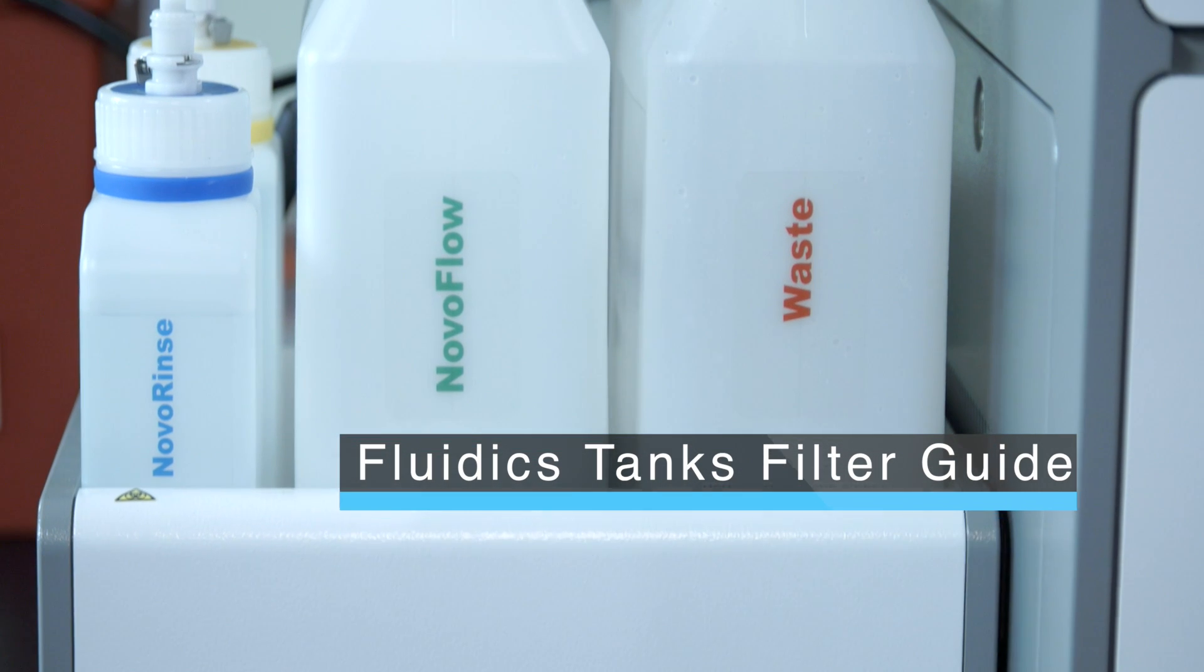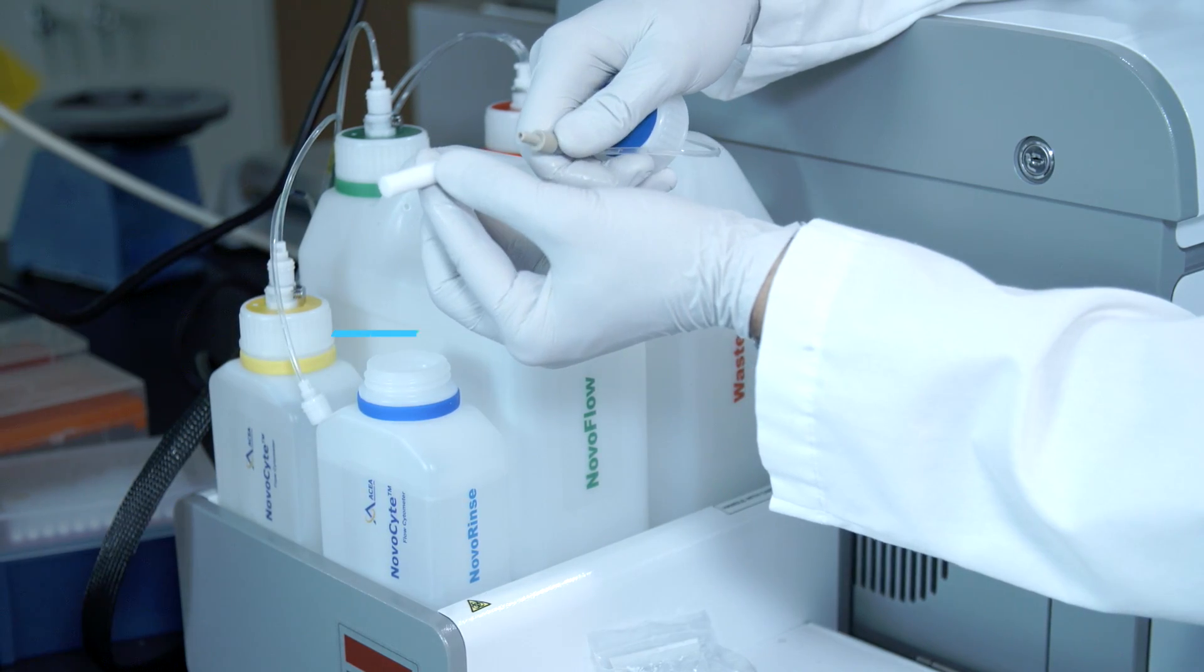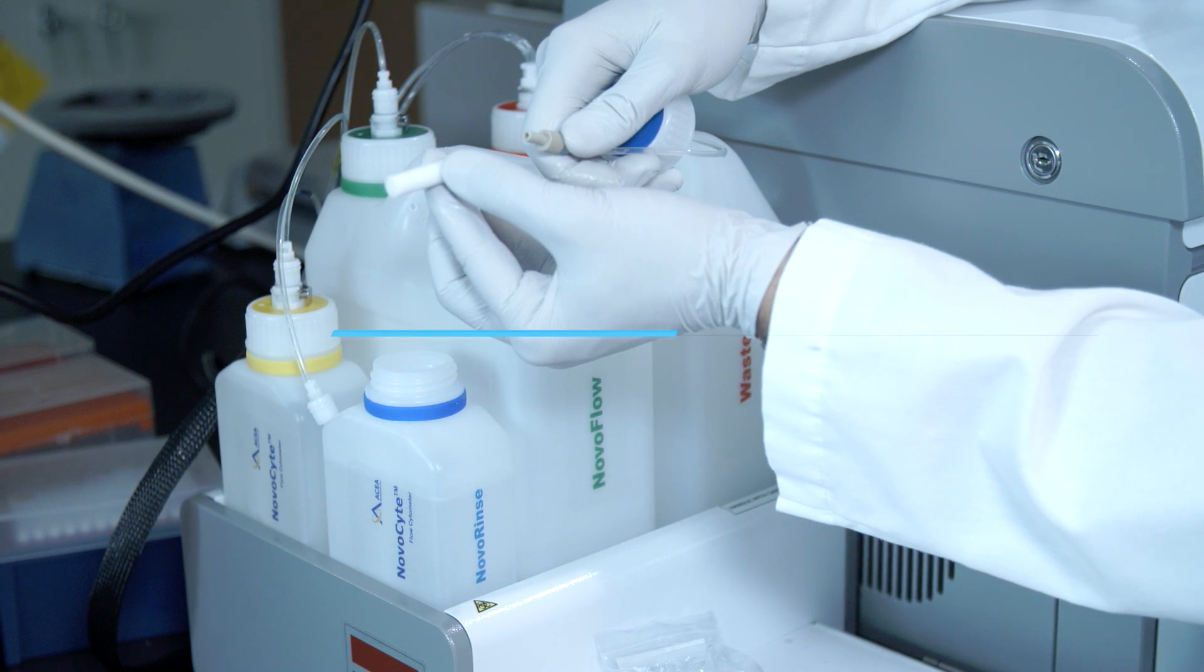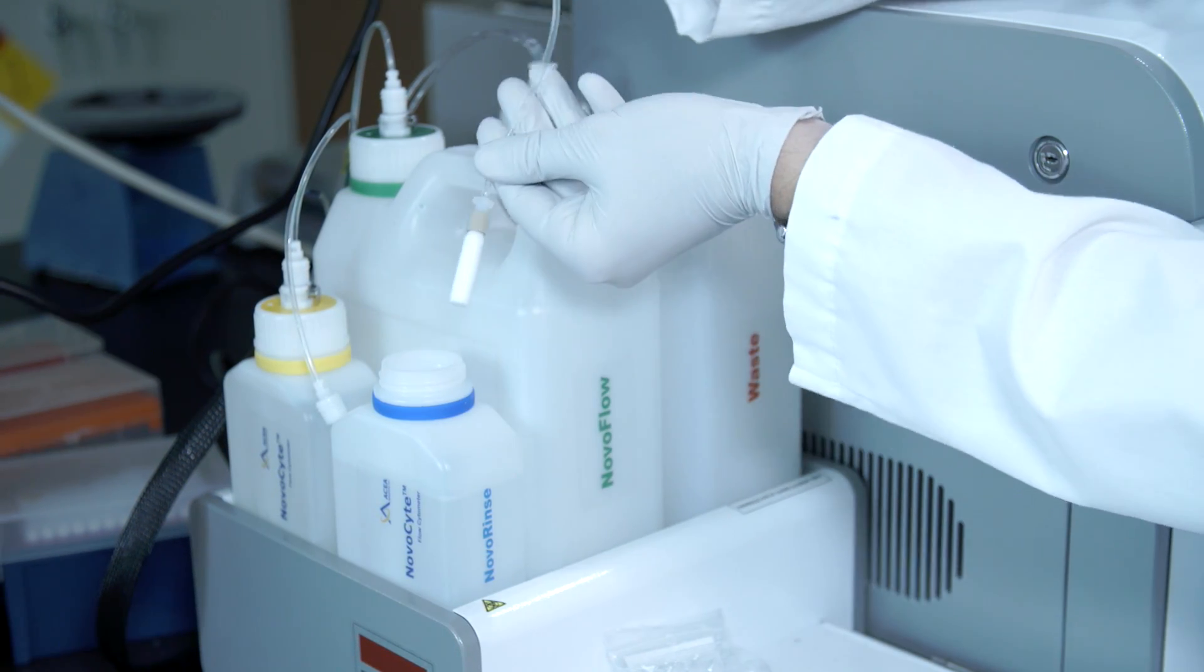The filters within the fluidics tanks are slightly different. Here is an example of the type of filter in Novo Rinse and Novo Clean tanks. All it requires is to pull off the old filter and push on a new one.